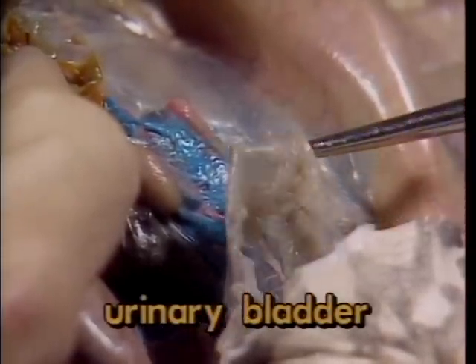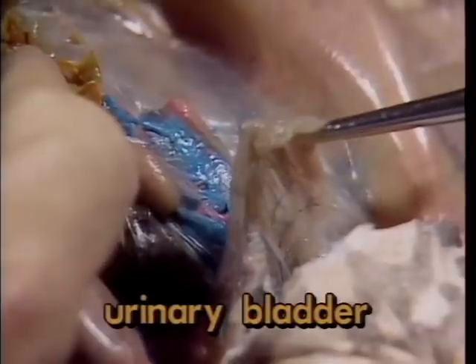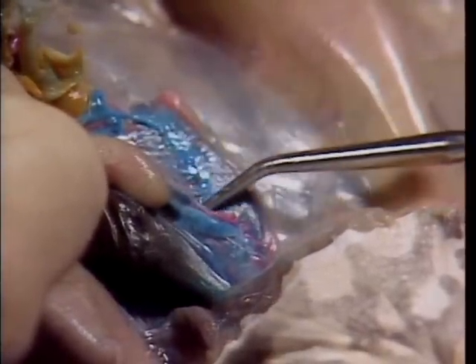From the archinephric ducts, urine is transported to the urinary bladder, seen here. Injection of latex may cause the kidneys to appear as blue masses lateral to the testes. Urine and during the breeding season, sperm are transported down the archinephric ducts to the cloaca.